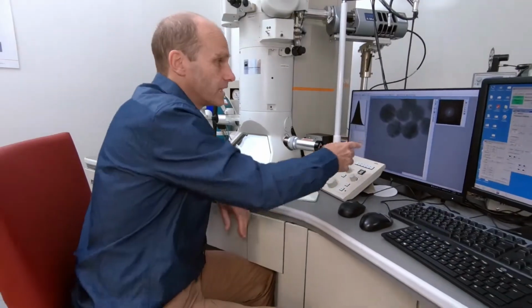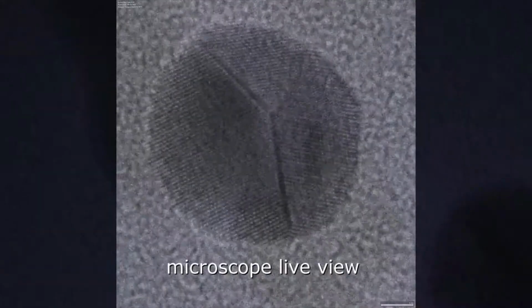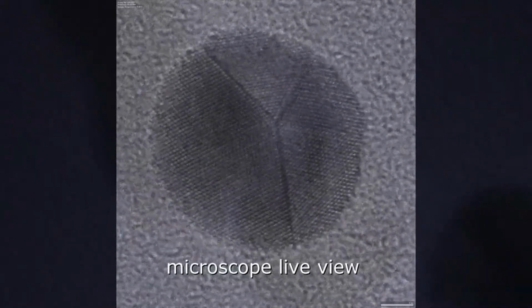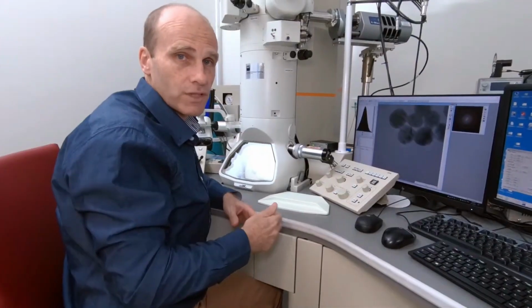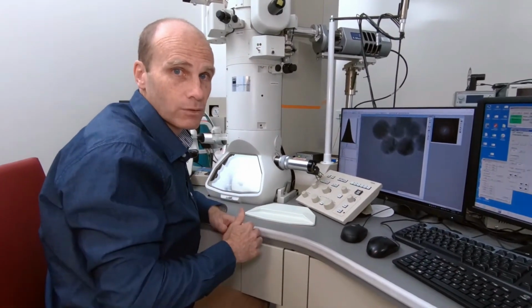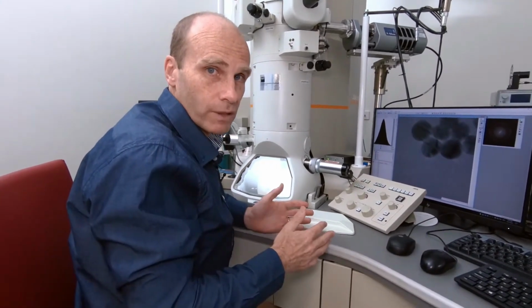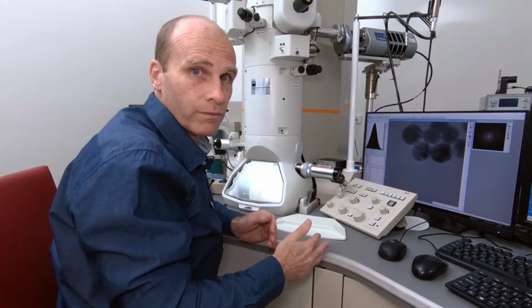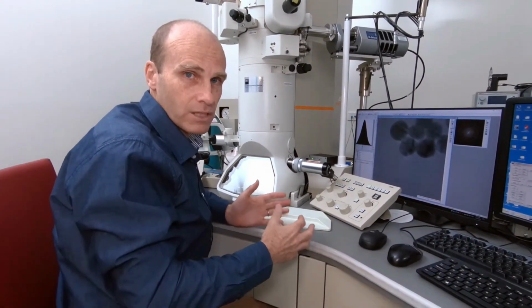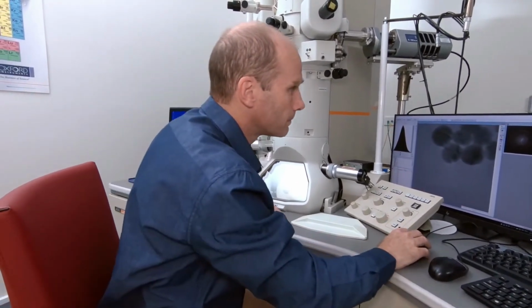Okay, so now we can see the lattice fringes that we have in our sample, and so this can give us the structural information. We can see features which are as low as about 2 angstroms in size, and we can use this to help identify what our sample actually is, in this case gold nanoparticles. We can also change over from looking at the structural information to looking at the crystallographic information by having a look at the diffraction pattern, and this can give us some more information about the crystal structure of the sample. So I'll go ahead and do that now.